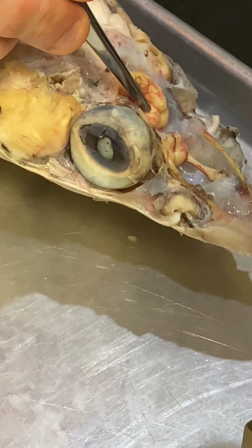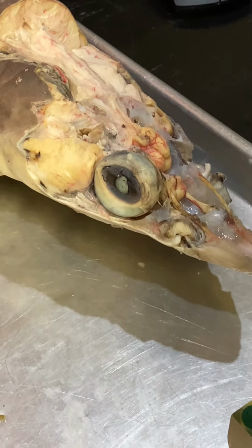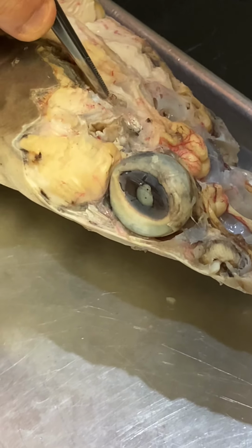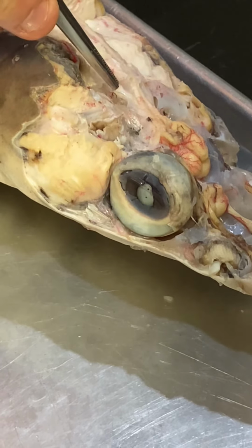What are these? Optic lobe. Optic lobes, right? So these are major structures I could pin, and I could ask you what they are. The same thing back here with the vagus and the glossopharyngeal nerve, because those are pretty obvious and distinct, because they're both running posterior. They're really large.